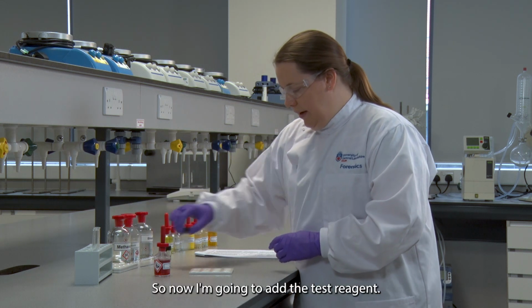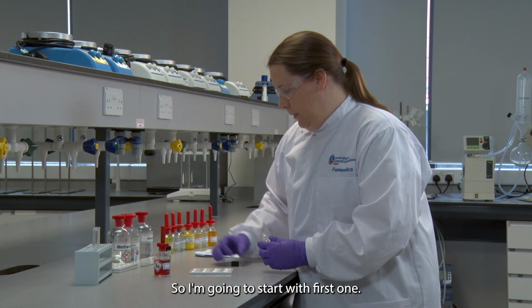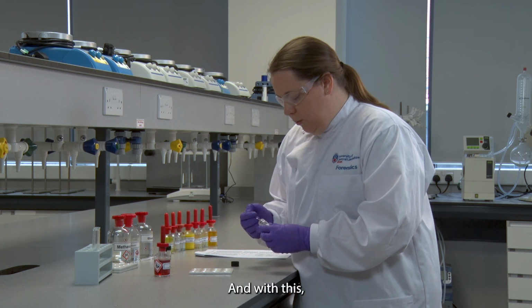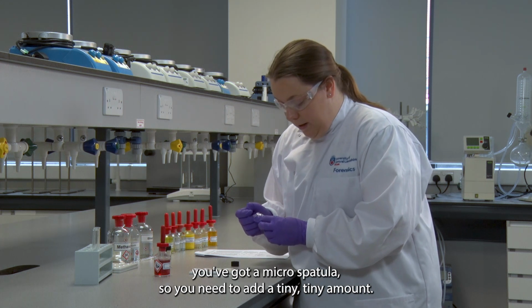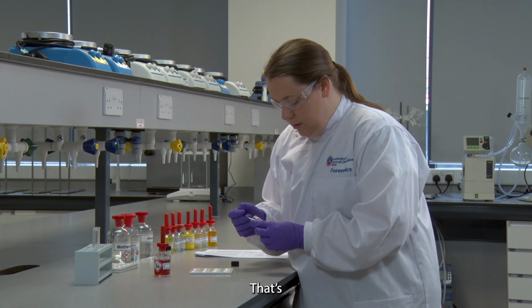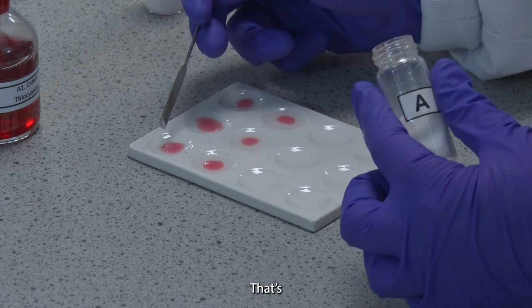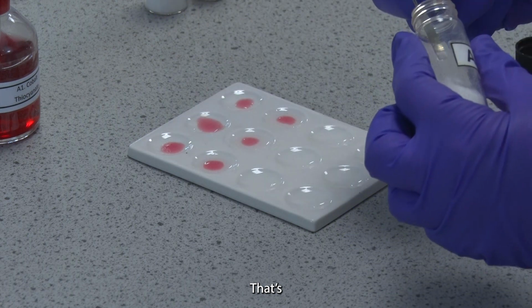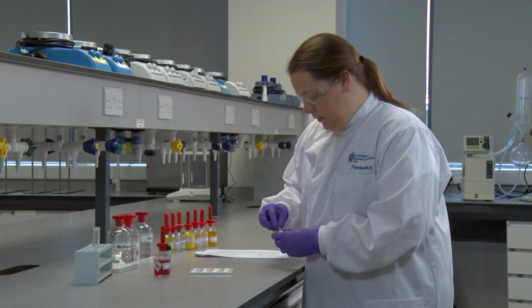So now I'm going to add the test reagent. I'm going to start with the first one, and with this you've got a micro spatula, so you need to add a tiny amount. That's the first one.